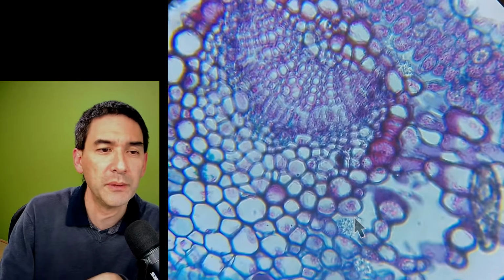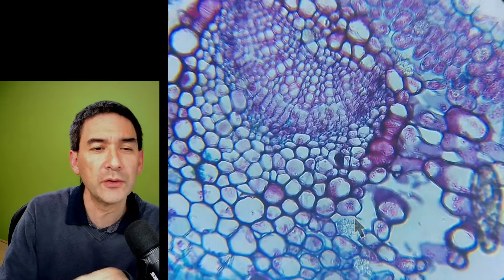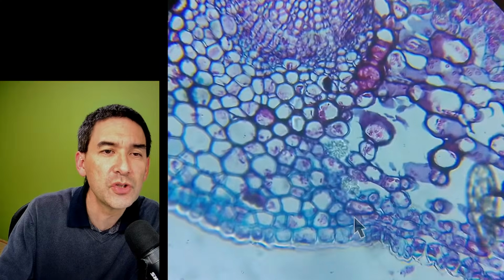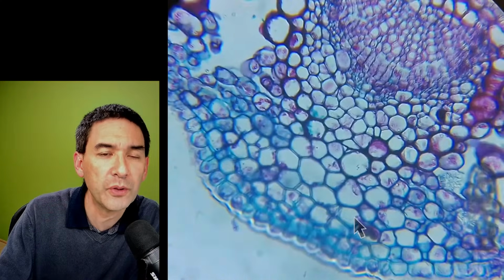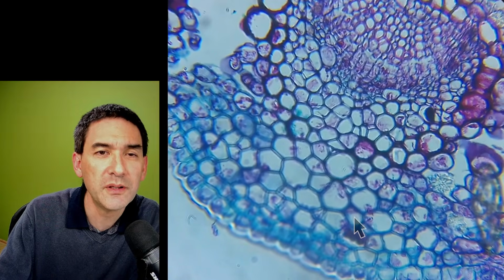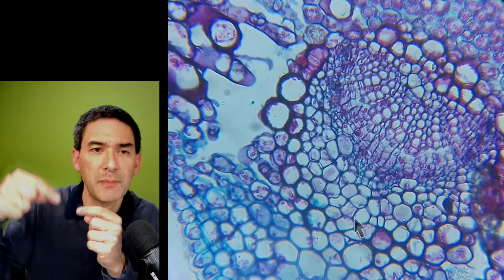That's a vascular bundle, and usually they're scattered around. Usually the larger cells you see here are xylem, and the smaller ones are phloem. The xylem tissue also usually has slightly thicker walls because it's responsible for structure and strength. But here I wouldn't know in detail which is the xylem and the phloem. Seen from the side, they have the spirals.